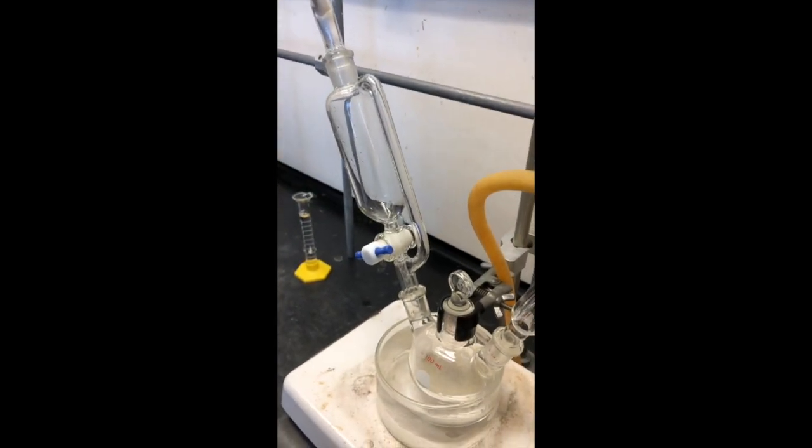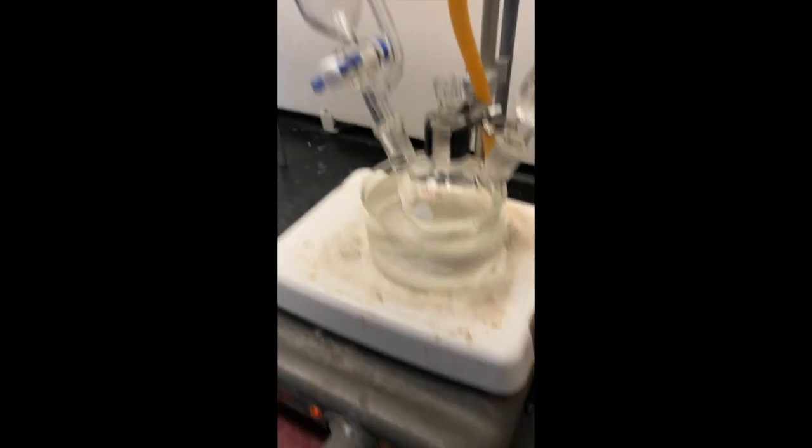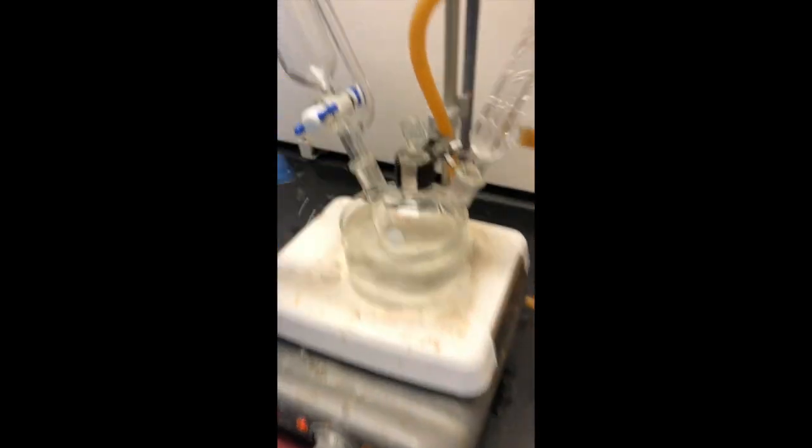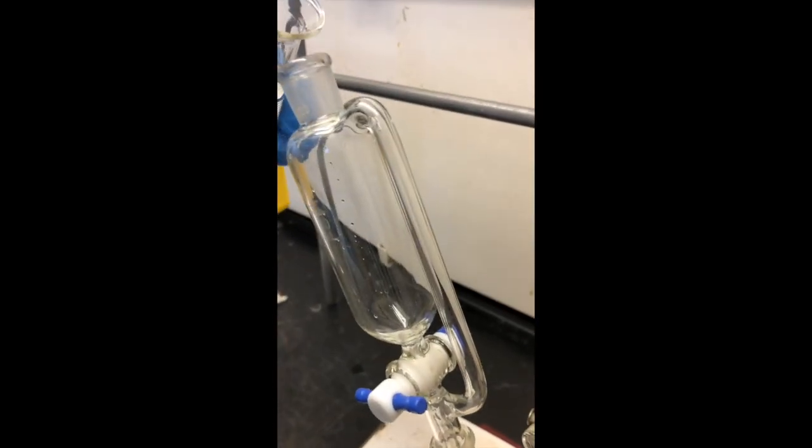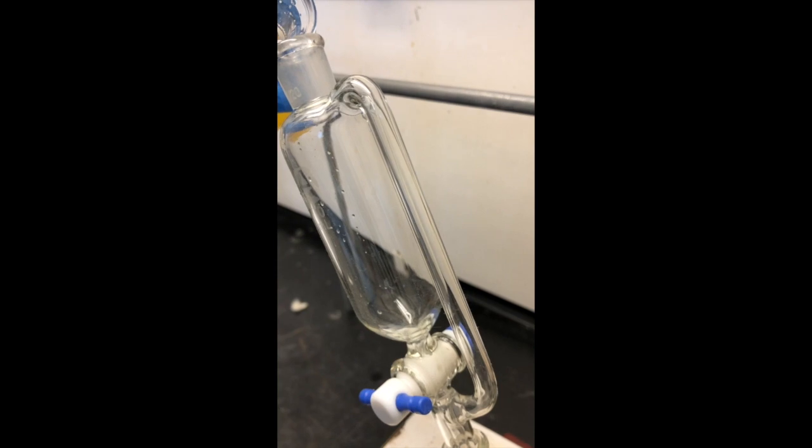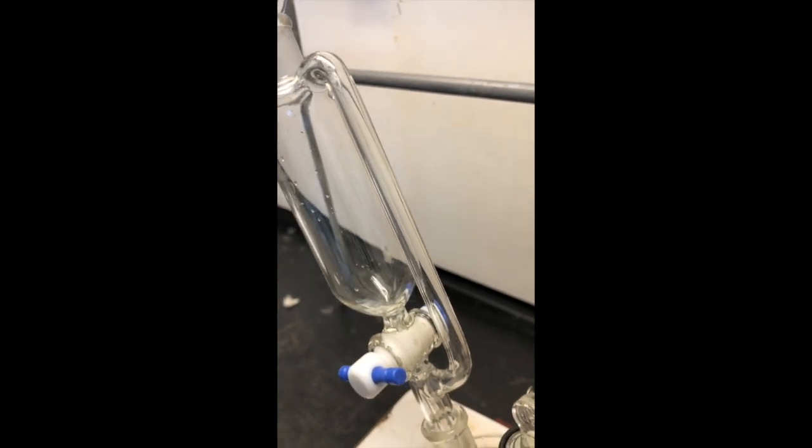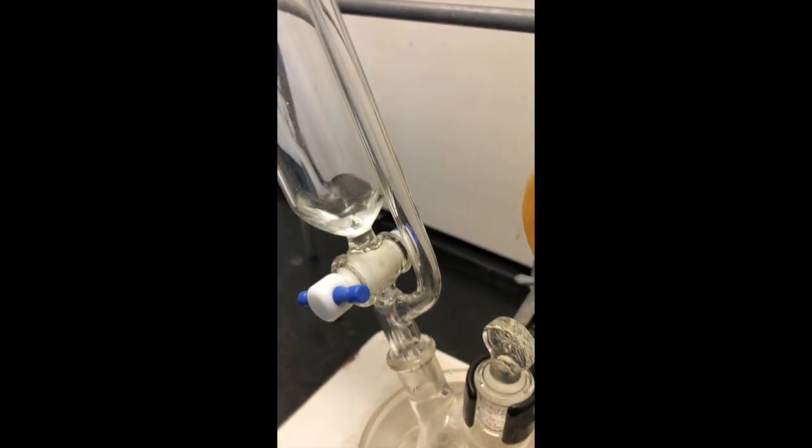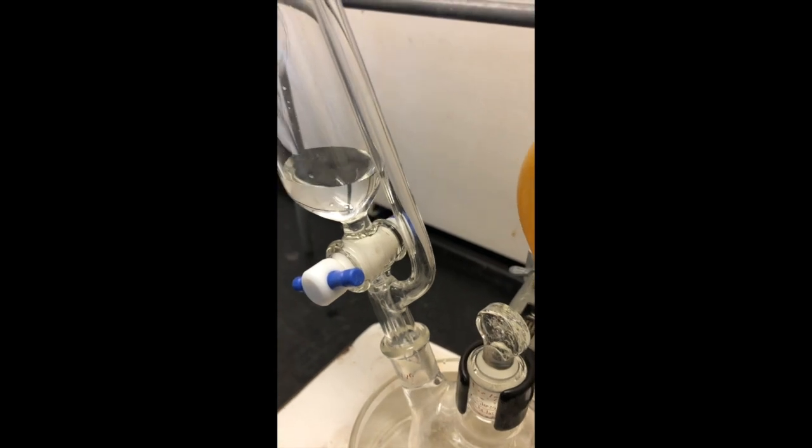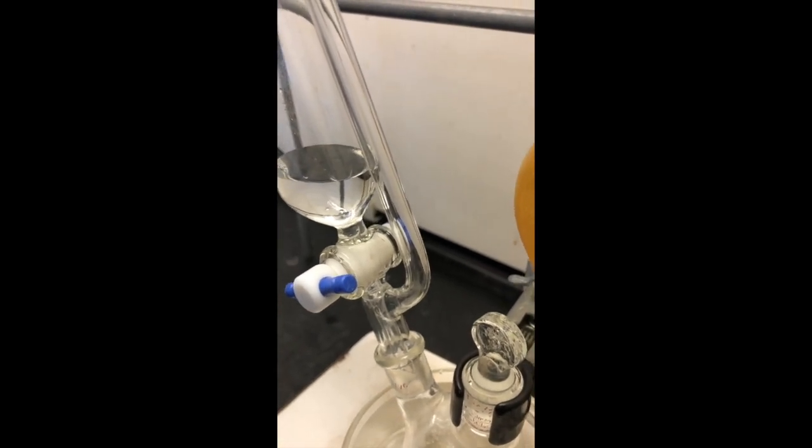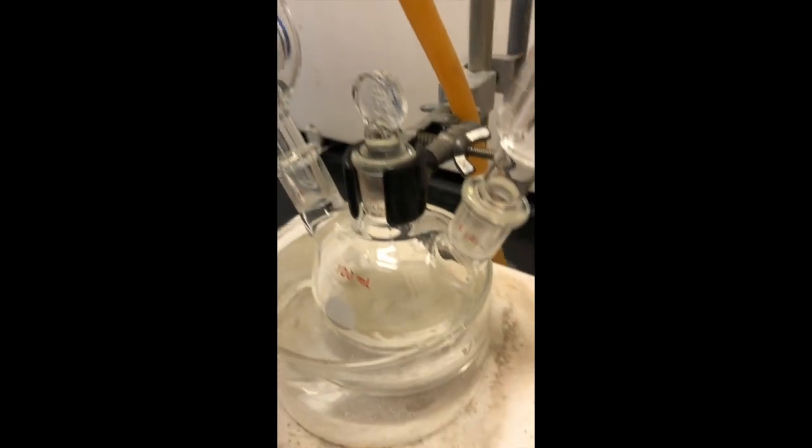So we're ready to now add the 12 milliliters of ammonium chloride. So we're going to add our ammonium chloride into the addition funnel. And once we open that, that will be the end of the anhydrous portion of our reaction today. You may now breathe.